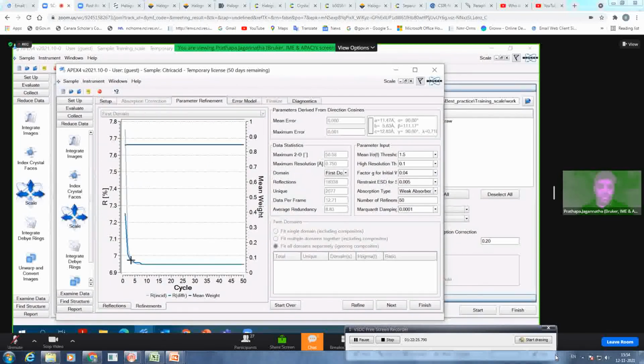Data looks good because your R incidence and R difference, R diffraction, converges to one particular value within 4 or 5 cycles, and then converges to one value. So this one, the light blue color represents only the scaling, and the dark blue color represents scaling along with the absorption. So if there is too much absorption, then there is a difference you can see at the end, but if there is not much, then it should converge to one particular value.